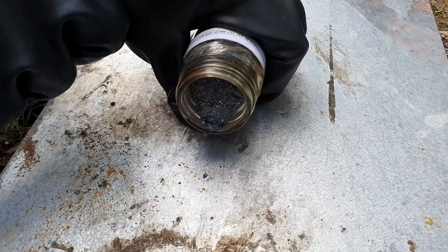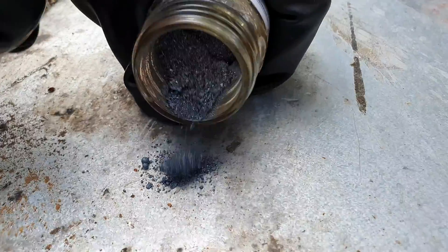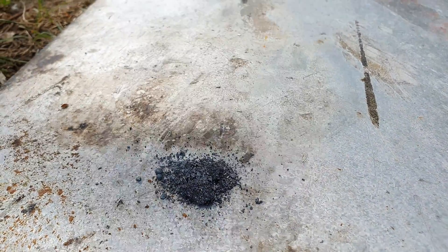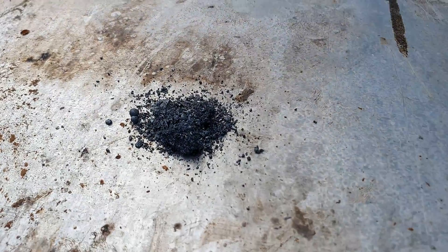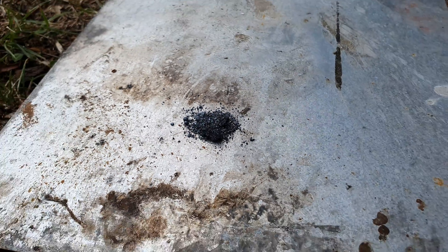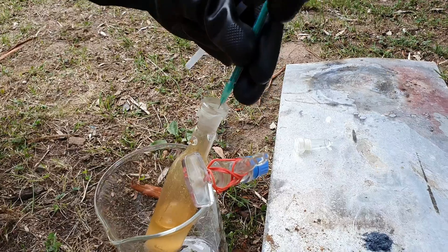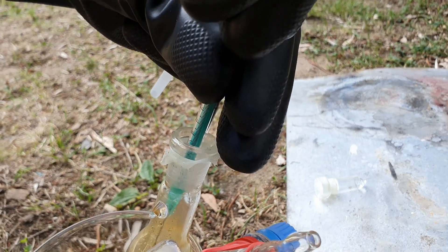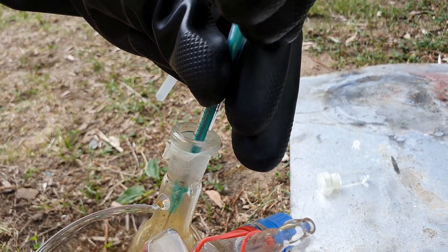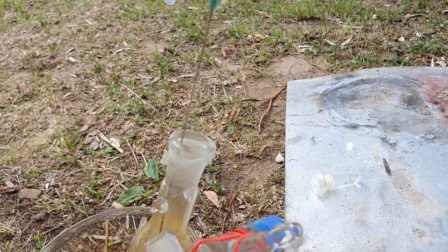We first wanted to see what the reaction between cesium and iodine looks like. We weren't sure if the reaction would be interesting since iodine is a solid and won't mix with cesium. On the other hand, iodine is a fairly electronegative element and cesium wants nothing more than getting rid of its electron. So we were curious to see what would happen. We pulled up a tiny amount of cesium with a syringe and dripped it onto the iodine.